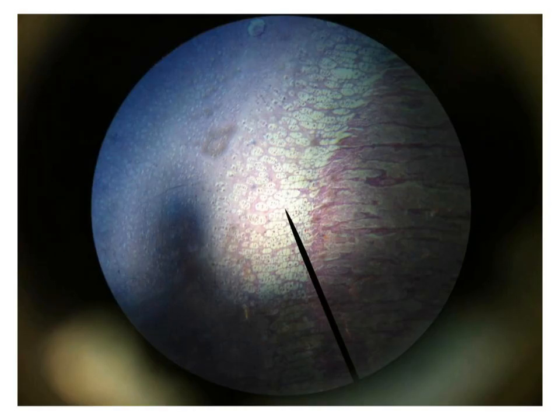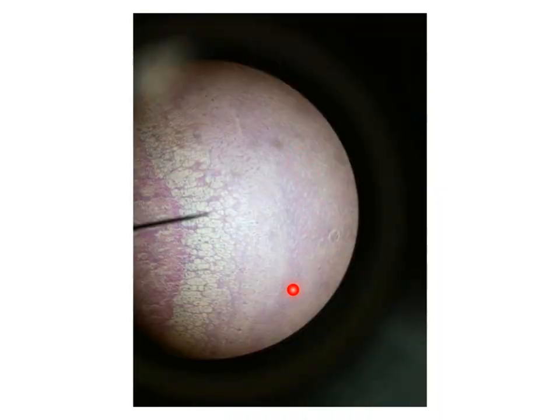Also another picture for the growing bone showing the blue area of the cartilage, the whitish area of the hypertrophy and calcification, and here the area of ossification with the red color. So you will see the different stages. Also the same, the area of the cartilage, the area of hypertrophy and calcification, the area of ossification.